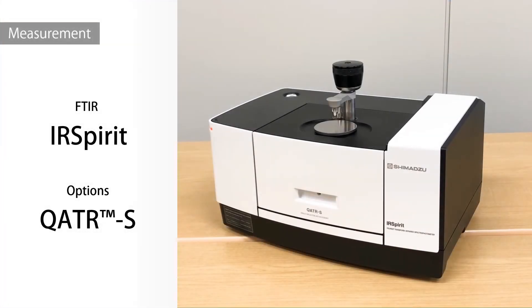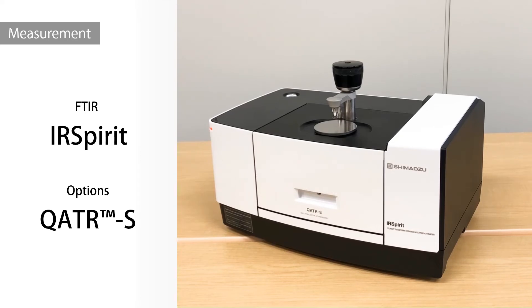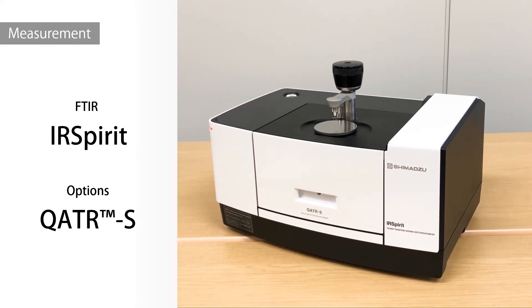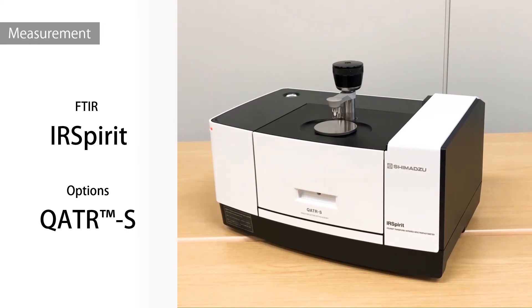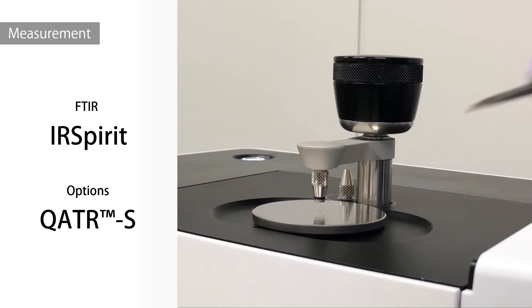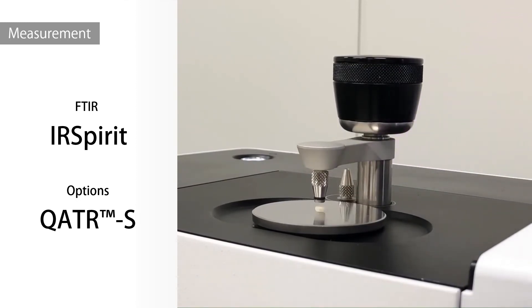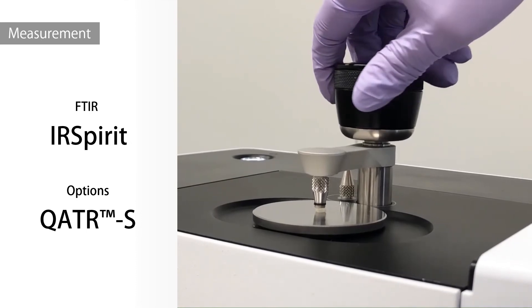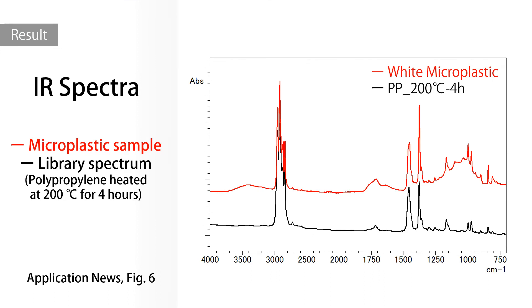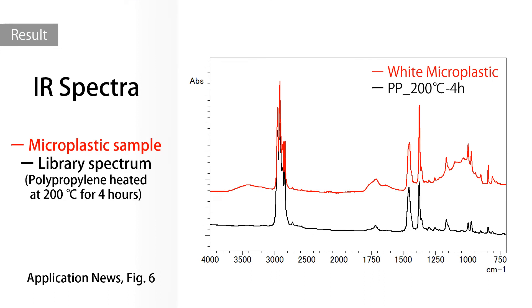Let's actually measure it. This time, we will use the Fourier Transform Infrared Spectrophotometer IR Spirit. The measurement was performed by the ATR method, which is a simple method requiring almost no sample pretreatment. The measurement is performed with this white microplastic in close contact with the central prism. The resulting sample spectrum was then searched against the Shimadzu Thermal Damaged Plastics Library.